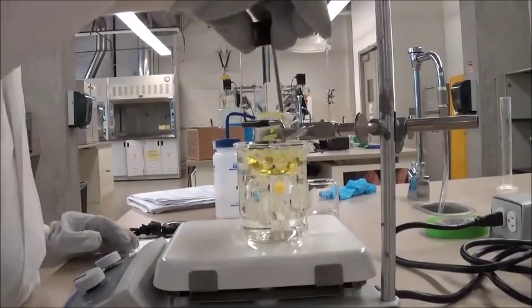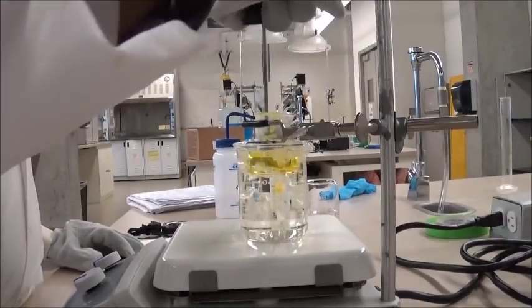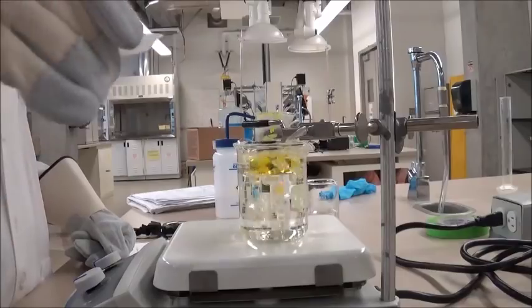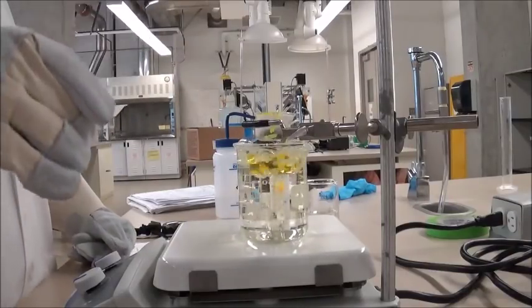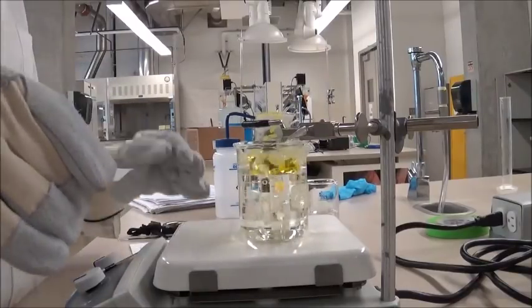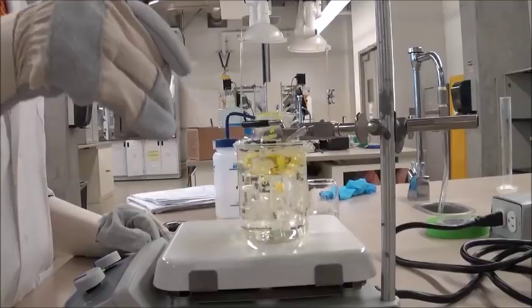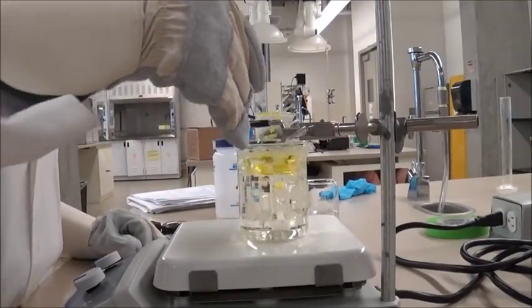So after you see that your 9-fluorenone has melted while you're stirring it, you can now take the unknown solid that you measured the mass of on the analytical balance, and add it into the 25 milliliter beaker containing the 9-fluorenone. Now for this step, be careful that you do not burn yourself, so you want to be wearing your heat resistant gloves again, and you want to be careful that all of the unknown solid that you measured goes into the 25 milliliter beaker. So be careful in this step.